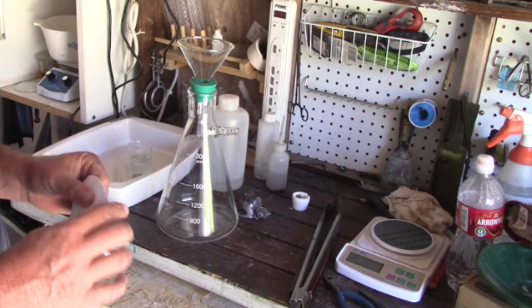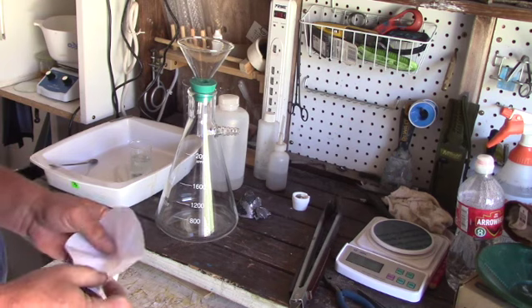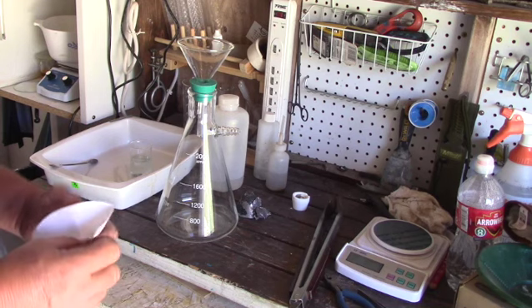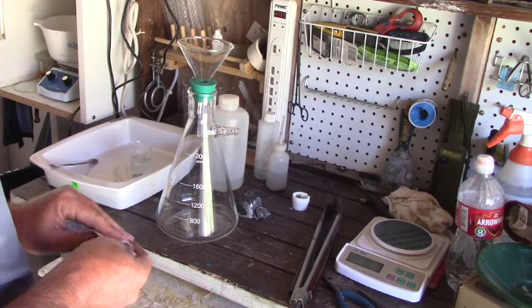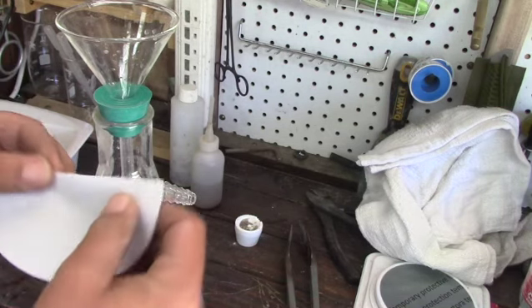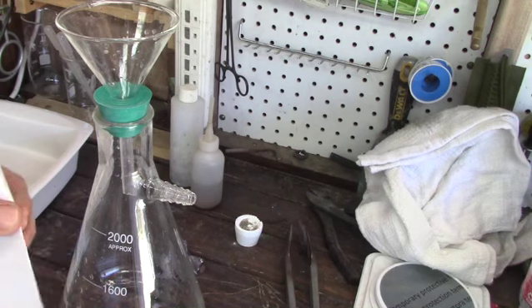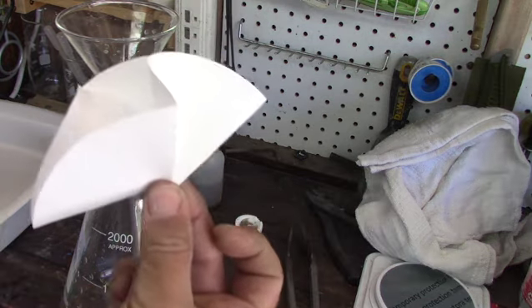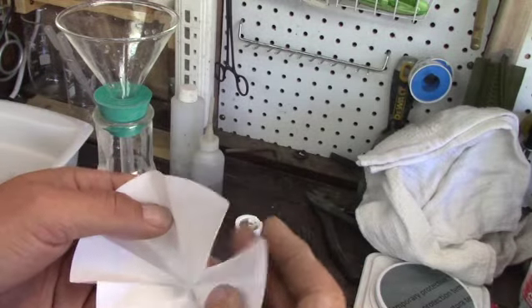So we're going to run it through the filter anyway and continue the process just to make sure we aren't being fooled. Most people fold filters by pleating them by hand — kind of time consuming and boring, and you tend to get the pleats wrong so it doesn't sit right in the funnel. Let me show you a better way. Take your filter, fold it in half, open it back up and fold it in half upon itself. Then you hold the filter and snap your fingers — boom. Pleats. All the pleats you could want.